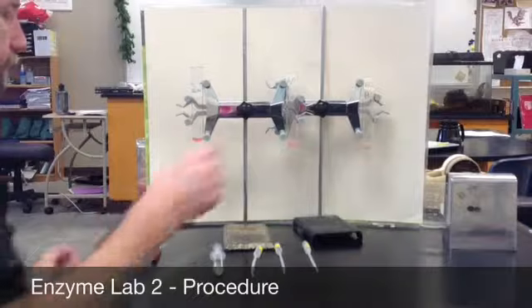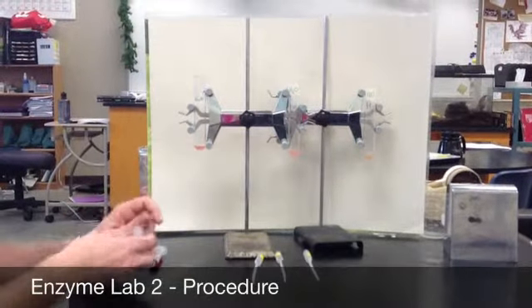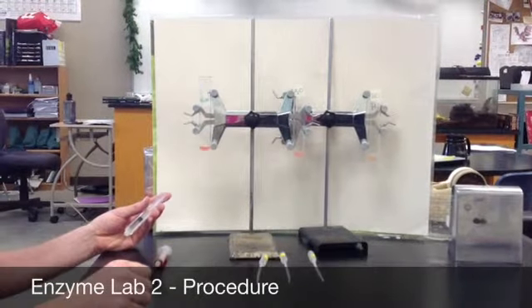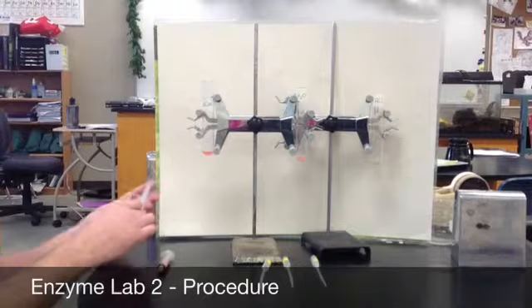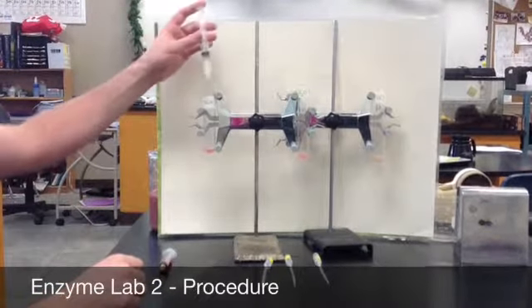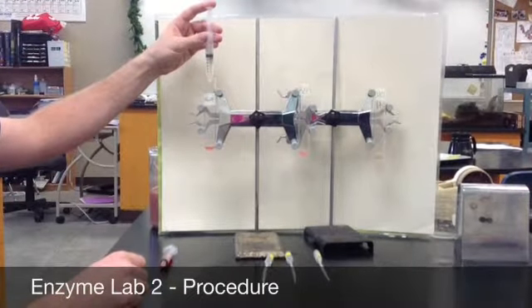All right. Our next piece is to add the hydrogen peroxide to see how catalase is going to help catalyze this reaction. So we'll add 2 milliliters to each of these test tubes. First one we'll do is the sodium hydroxide, the base. So we'll add 2 milliliters to that.